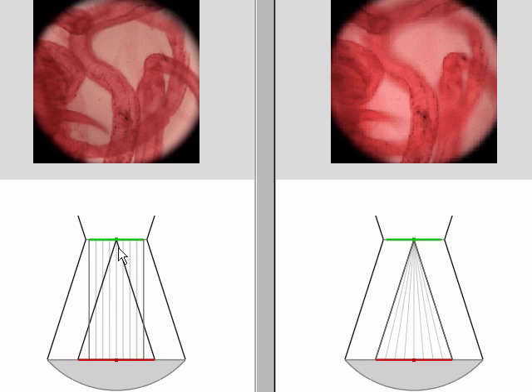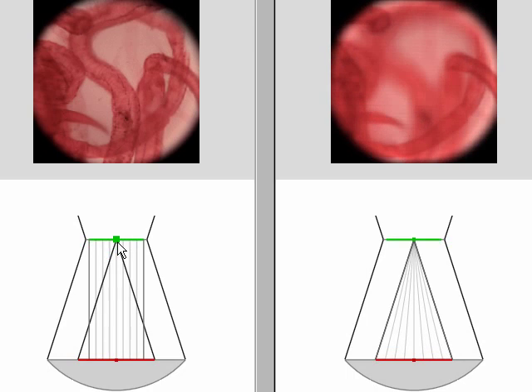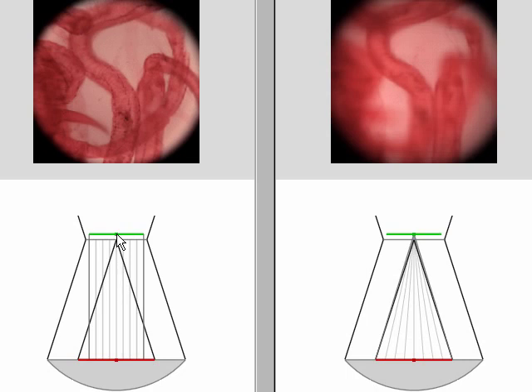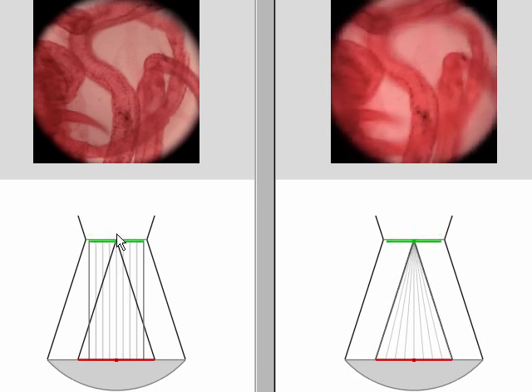Returning to orthographic views, we can compute a synthetic aperture image, shown in the upper right, focused at a particular plane. By moving that plane, we can focus on the legs in the front, the legs in the middle, or the legs in the back. And if we're willing to compete with the screen capture program for bandwidth, we can interactively move the plane through the specimen.